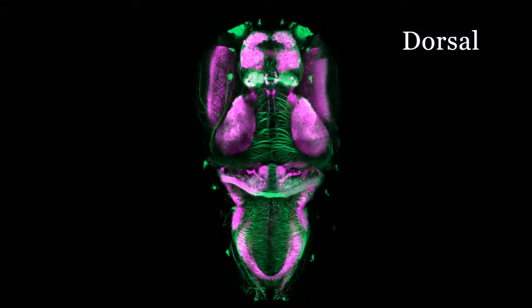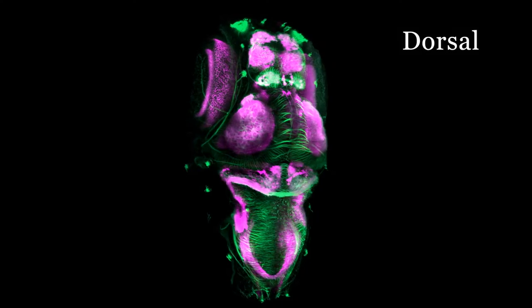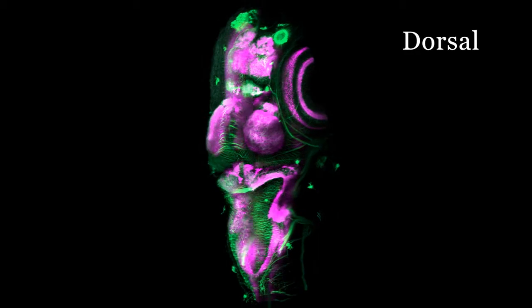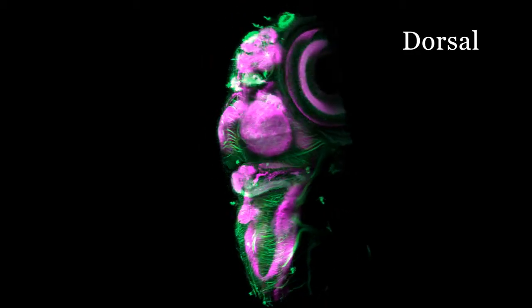Here is an undissected, three-dimensional view of a zebrafish head showing immunohistochemistry using our most frequently used antibodies. Anti-acetylated tubulin in green, which marks axon tracts primarily, and SV2 in magenta, which marks the neuropil. This dataset was taken from a dorsally mounted specimen and does not show the full depth of the head. For example, only the dorsal half of the eye can be seen.